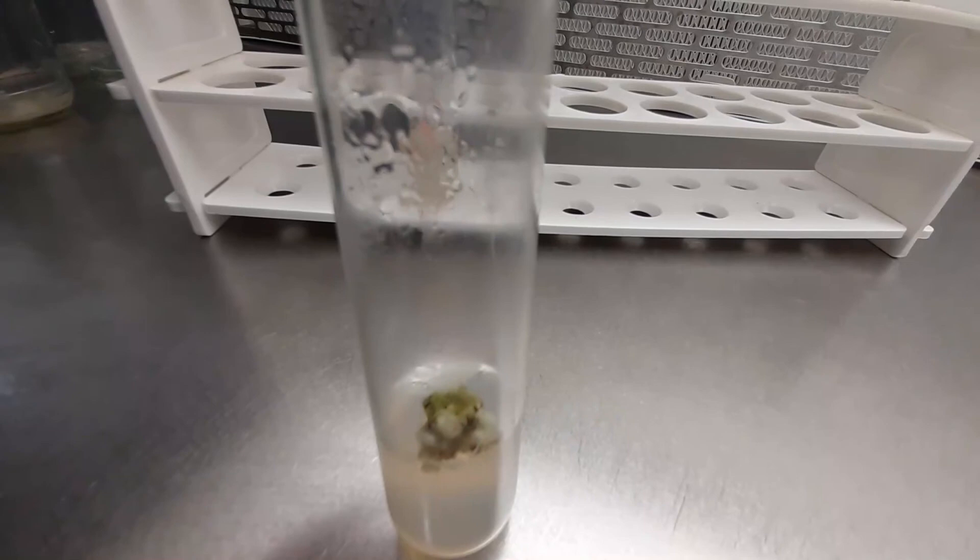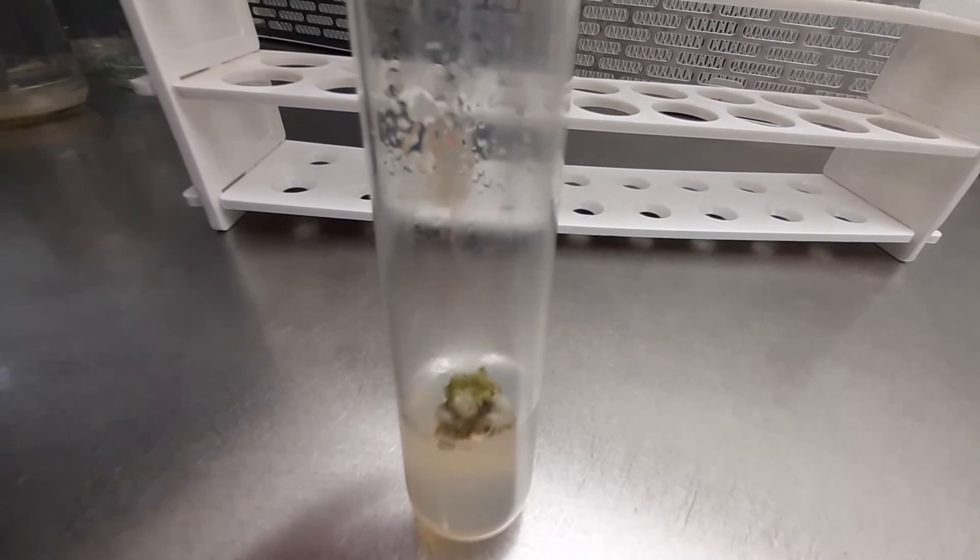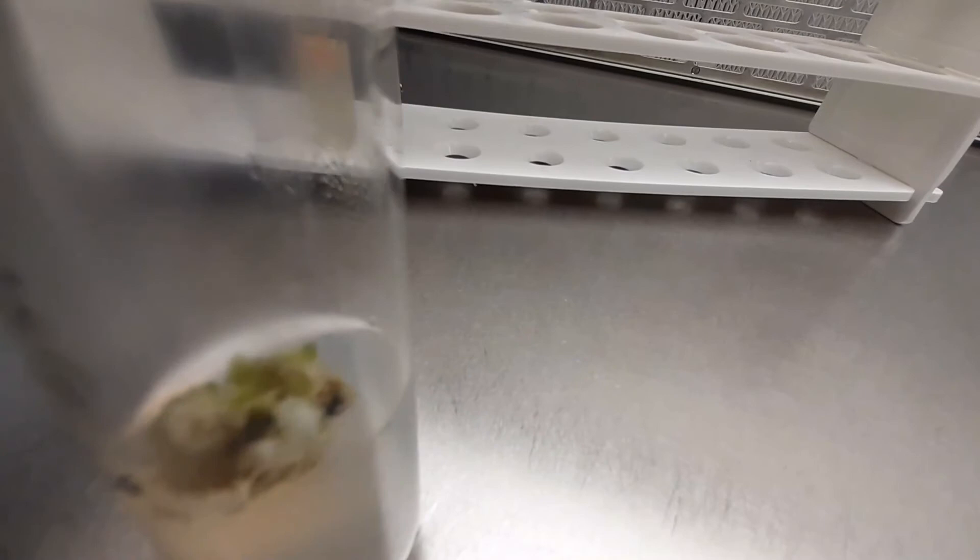After inoculation into the tube and incubation in dark and light conditions respectively, after almost 1 to 1.5 months, you will see this kind of callus develop in the test tube.